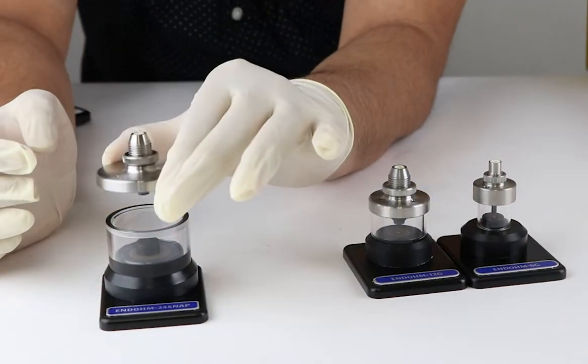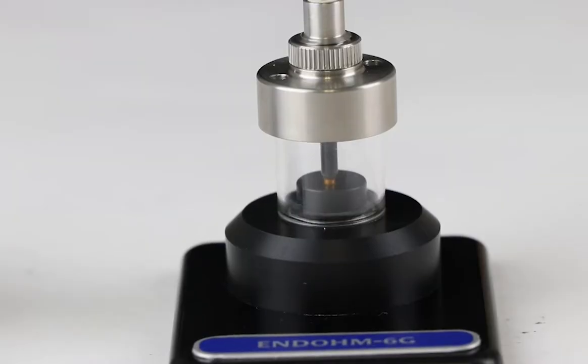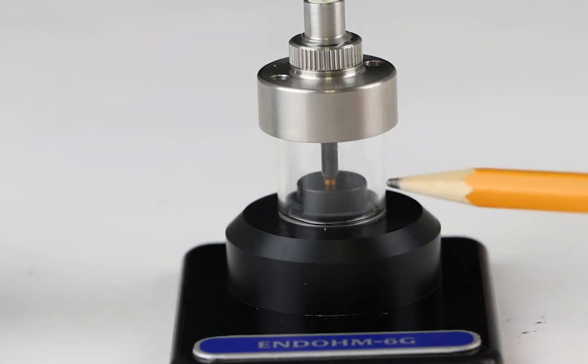The gap between the top and bottom electrode affects the resistance readouts. Using the spacer, the user can make sure that the same 4mm or 6mm gap is maintained to minimize data variability due to electrode spacing.